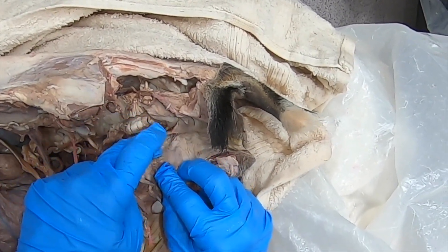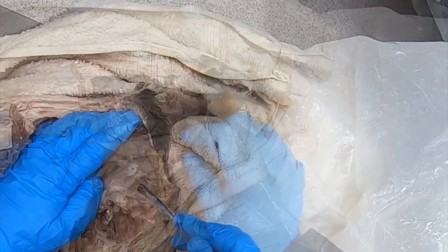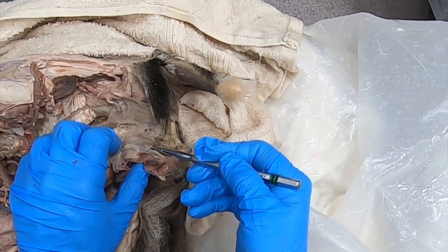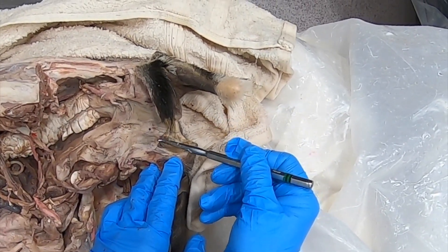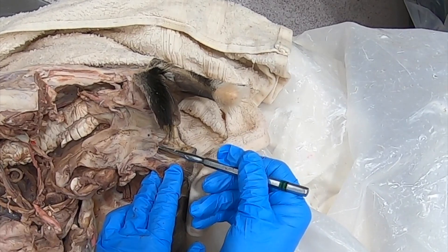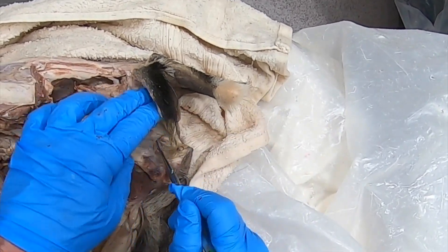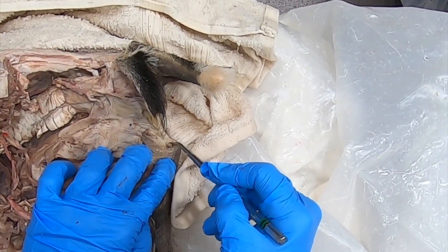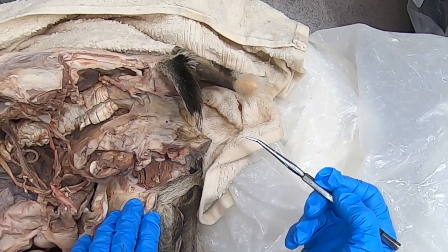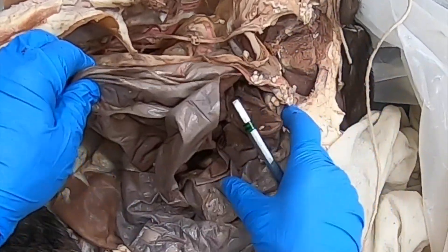We've opened up the uterus and are going down through the cervix — the cervix isn't quite fully opened up. Then we have the external urethral orifice, and just below the urethra is a small space called the suburethral diverticulum. Above that is the urethra, making this area the vestibule. Here we have the clitoris and the clitoral fossa, and the labia of the vulva.